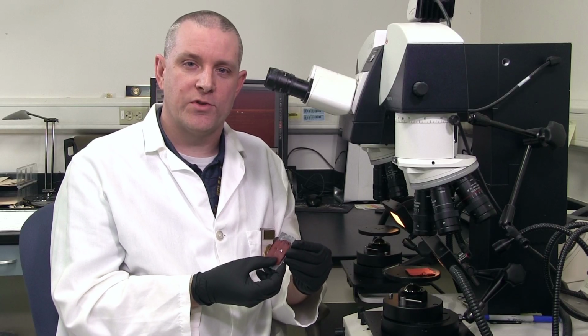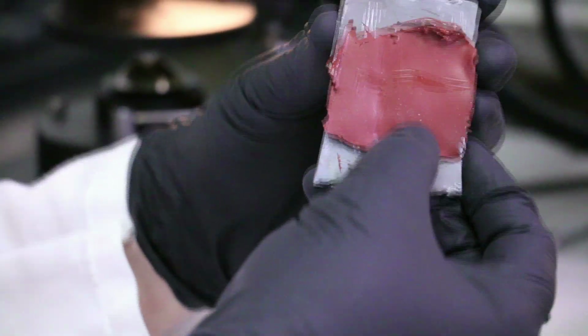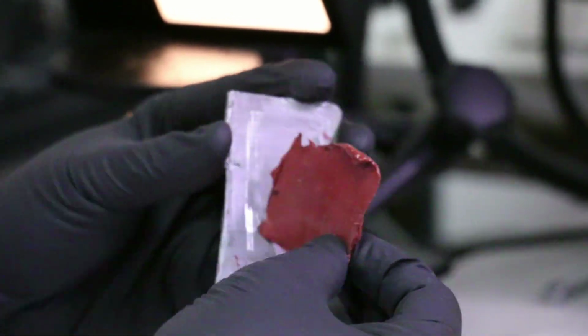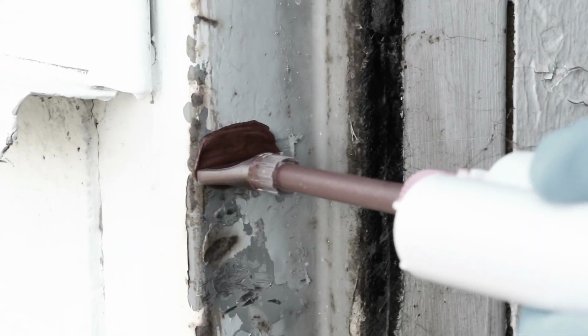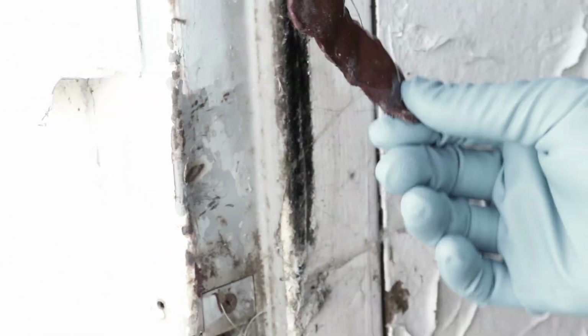So now we're at the microscope. The first thing we're going to do is take that cast that we made using the crowbar and peel it off and put it on the left side of the microscope. And once we do that, we're going to compare that to the cast that was made of the mark that was found on the barn door that was recovered by our agents in the field. That's going to go on the right side of the microscope.